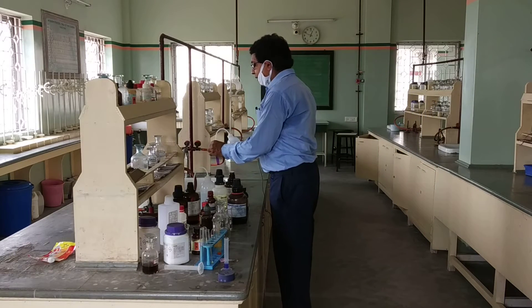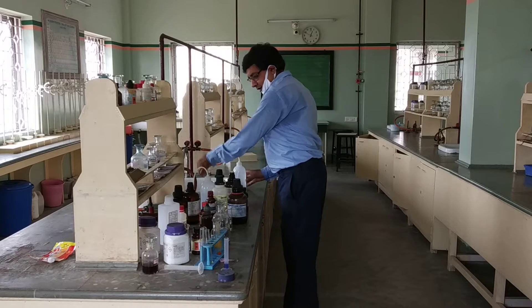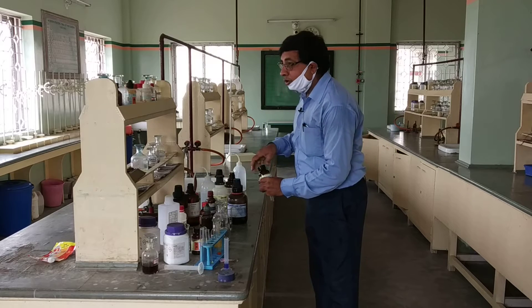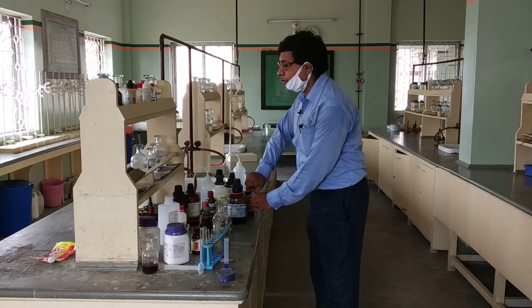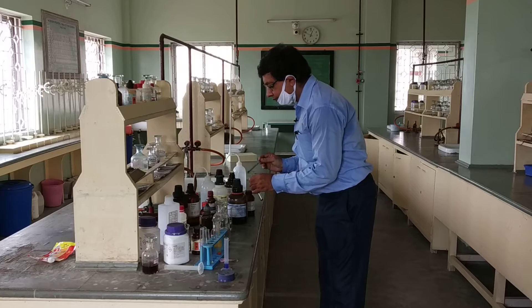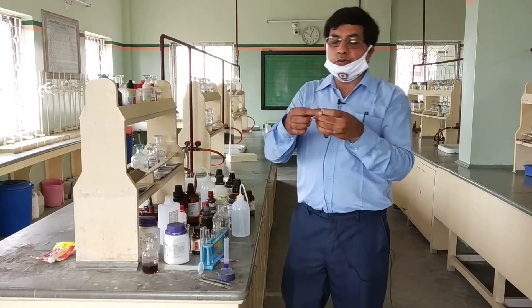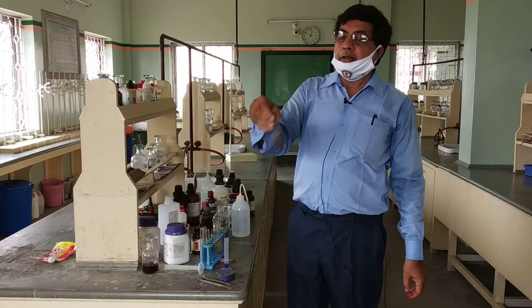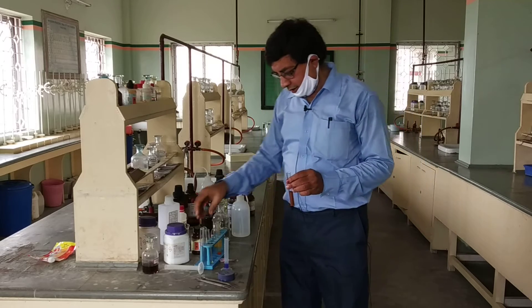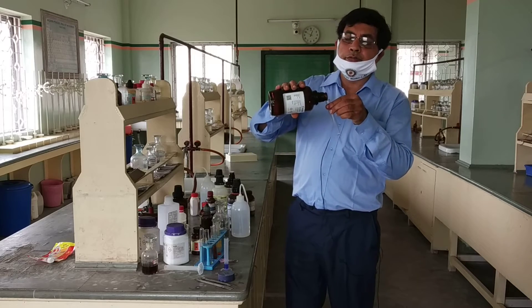Another test is the sodium nitroprusside test. In the sodium nitroprusside test, you first prepare the sodium nitroprusside. Since it is a sodium salt, it must be dissolved in water. In the final exam, the sodium nitroprusside solution will already be present in the lab. You take another test tube and add the acetone solution.